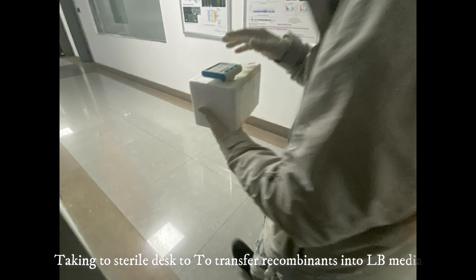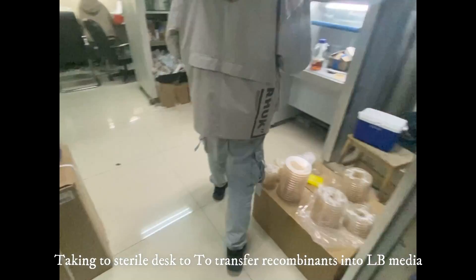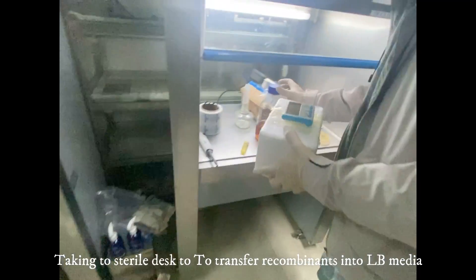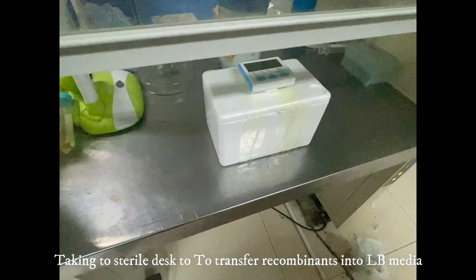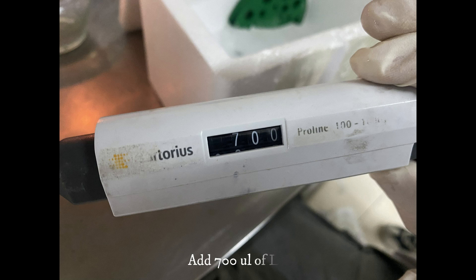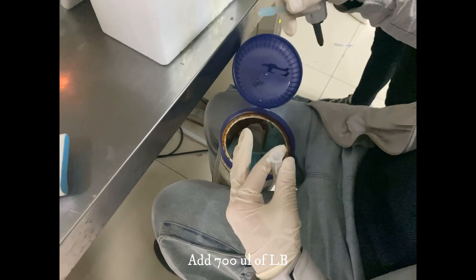After that we can take it to the sterile room for further inoculation. We can transfer the LB media to these recombinant PCR products. We need a sterile environment in order to avoid contamination, and we need to transfer 700µL of LB media to the transformation product.